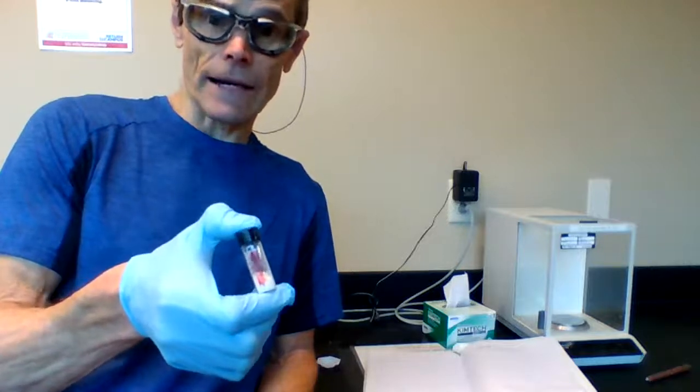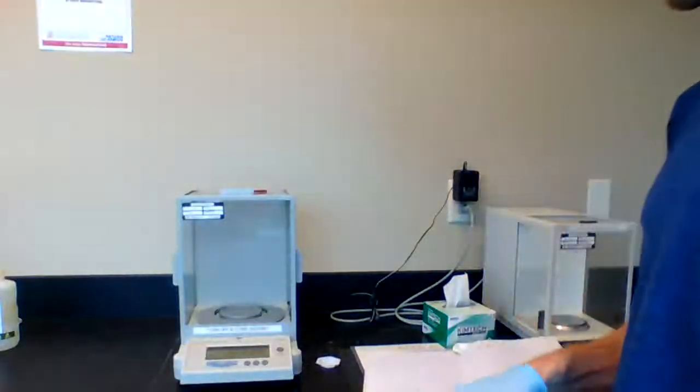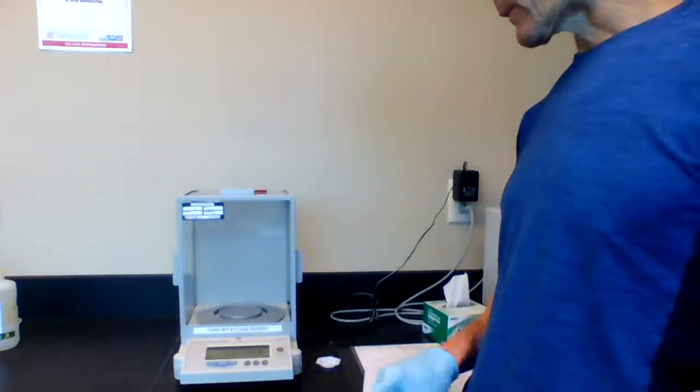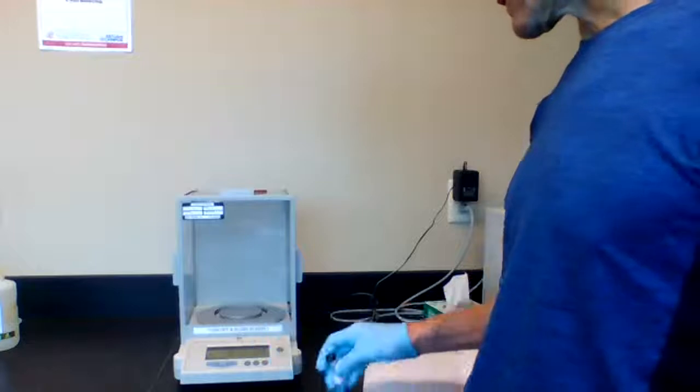So I'm here in the balance room and I'm going to go through how we would take a sample. And this is a red labeled sample of KHP, such as you'll be using in experiment 1. It's the standard. It's roughly 99.9% pure KHP. So what we do in this exercise is we come into our balance room and we would recognize that our balance is tared. We set it at 0.